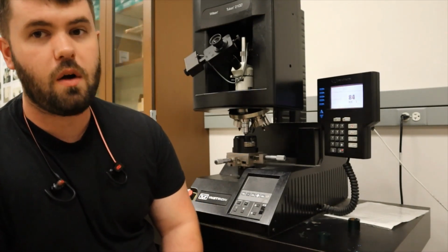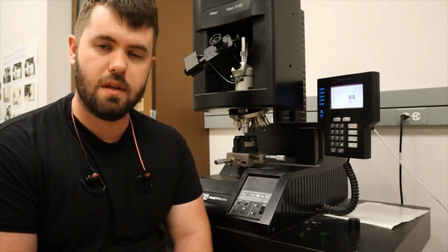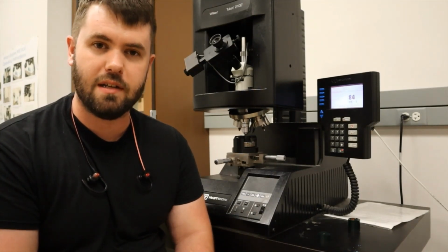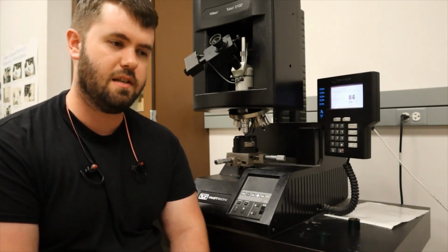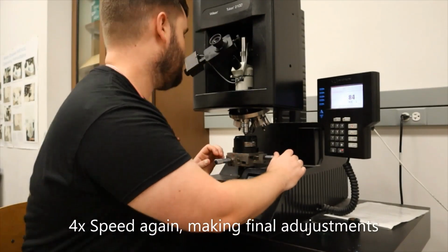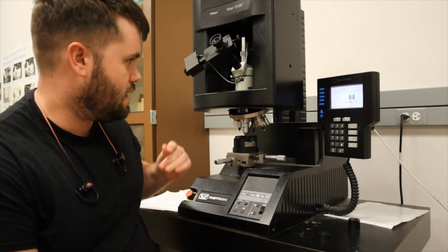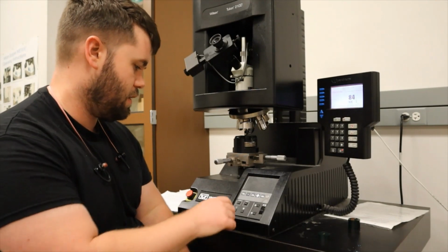Generally, for the Rockwell, they said at least 3 indent diameters away from the indentation. For Vickers, I don't know if there is an exact scale for how far away you need to be, but generally I just move the old indent off the view screen and go to a new place of unindented material. I found a clean location with no indents, and I have it in focus now, so I'm going to turn it to our Knoop indenter, and I'm going to go ahead and hit the start button.